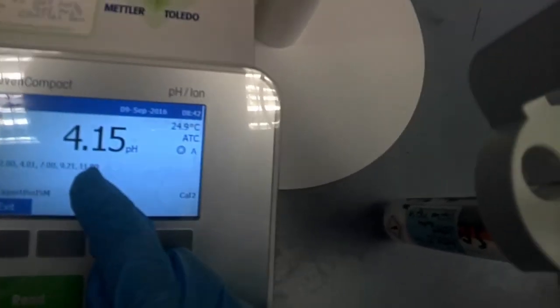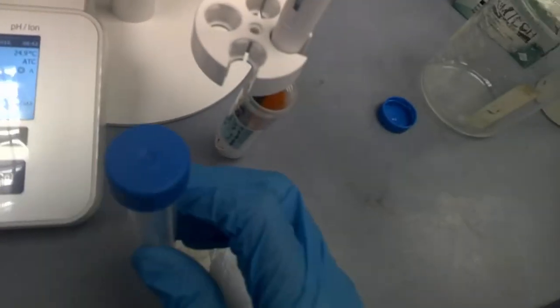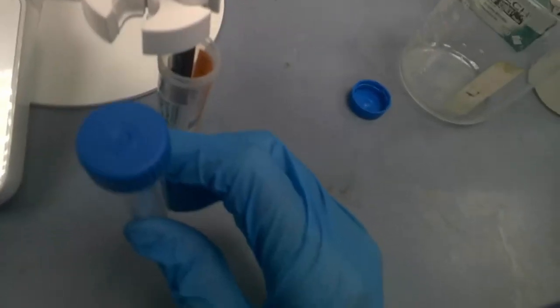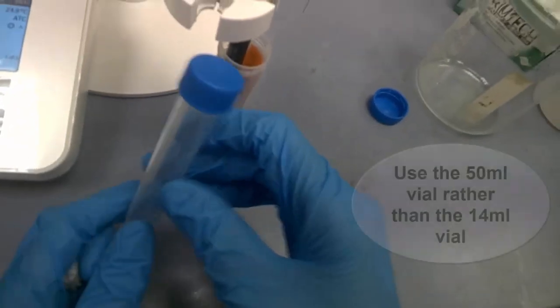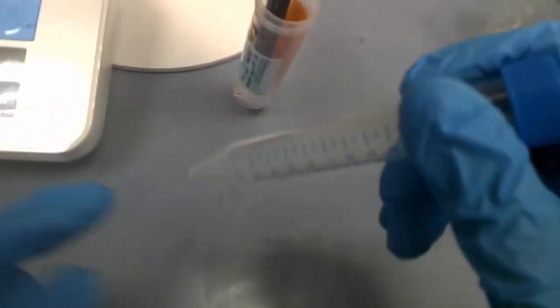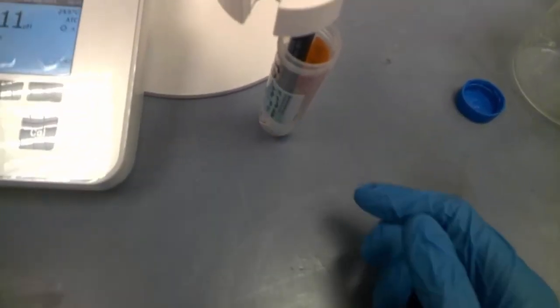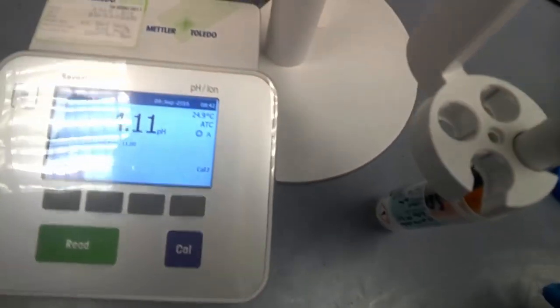Now, meanwhile, let me just show you these two vials. The big one, this pH probe can fit inside as I've shown you. But what about the small one? The small one is able to just nice make sure that the pH probe enters it. But if you have some bubbles here, that means you cannot shake it. There's no space for them to just get rid of the bubbles. So we'll advise you to just stick to the larger vial. So again, let's wait for it. Wait for this pH to be calibrated.